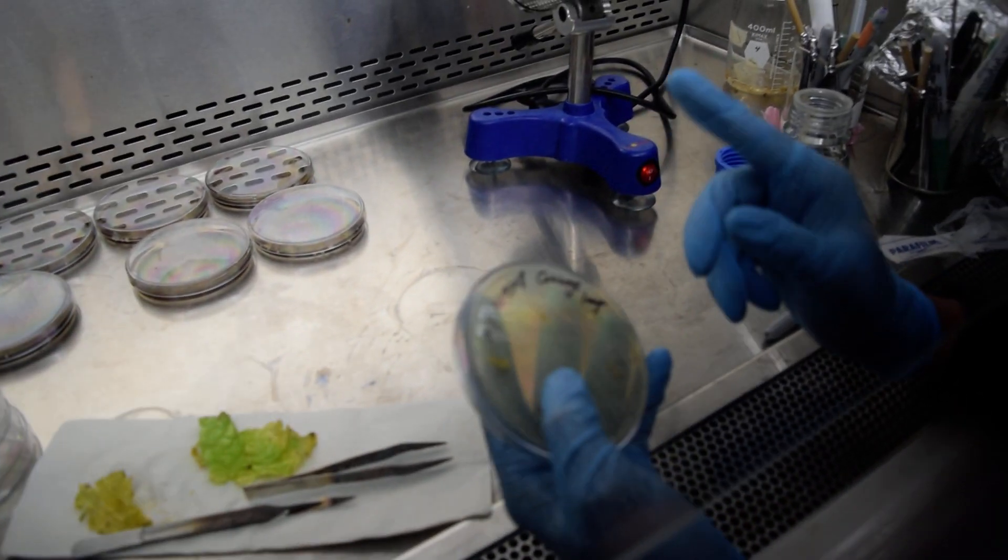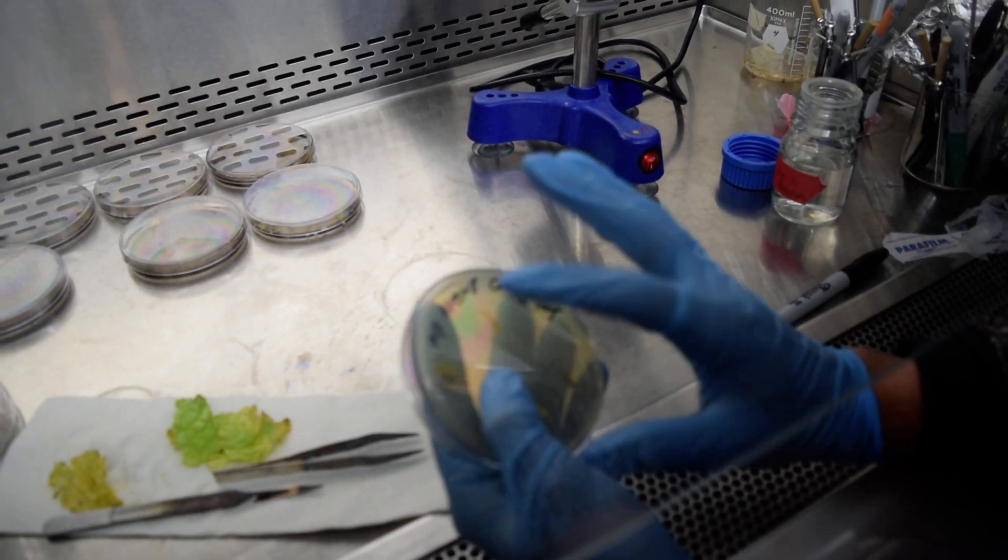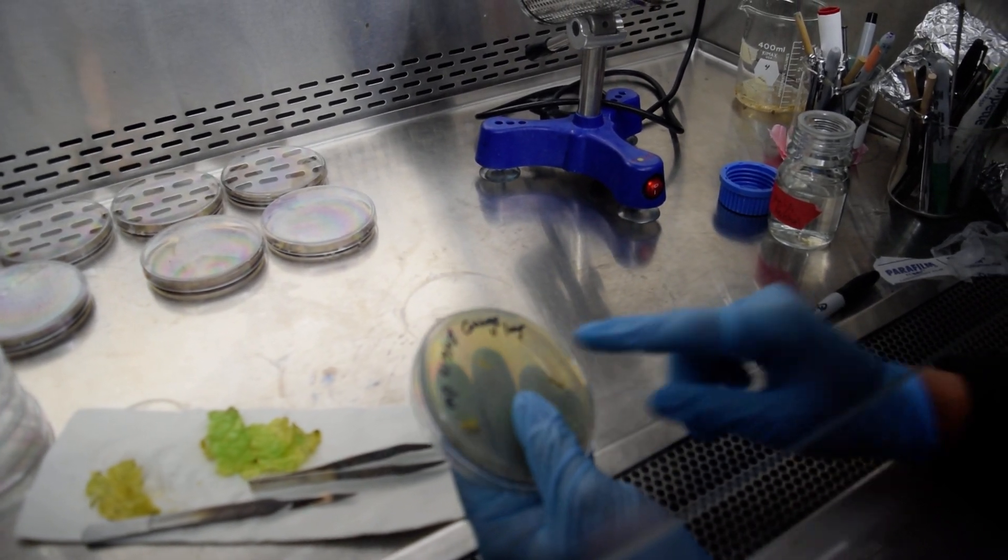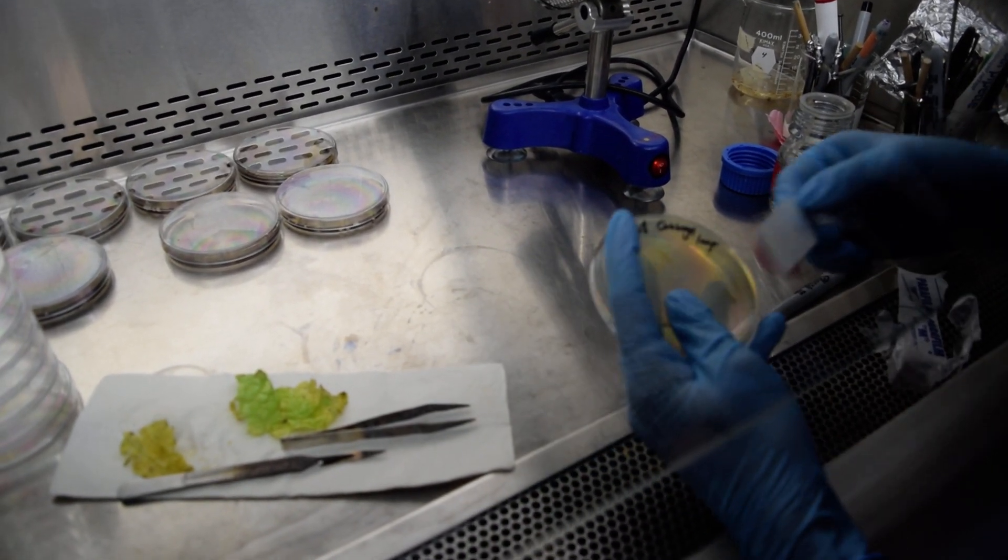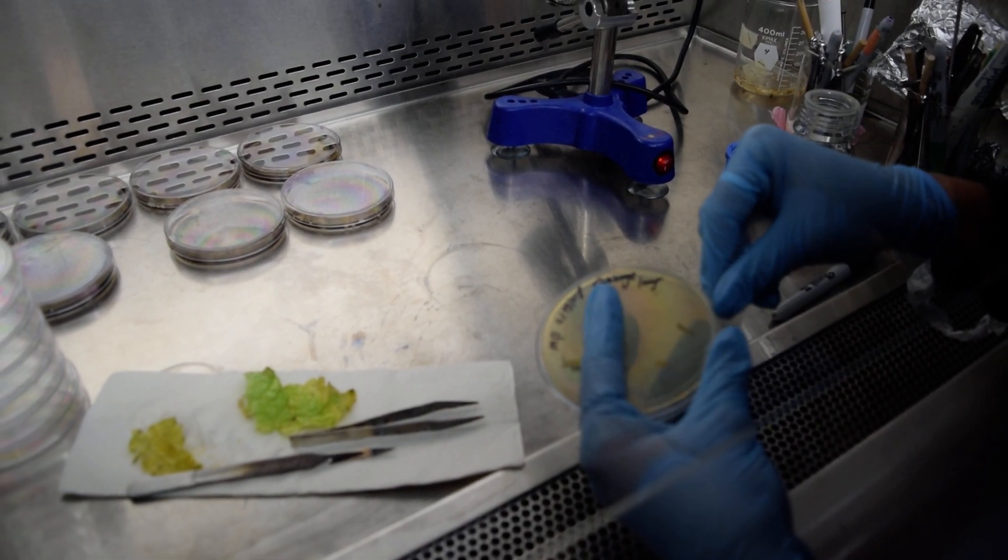The plate should be labeled with the name of instructor, date, and the plant part collected. And finally, it should be wrapped with parafilm.